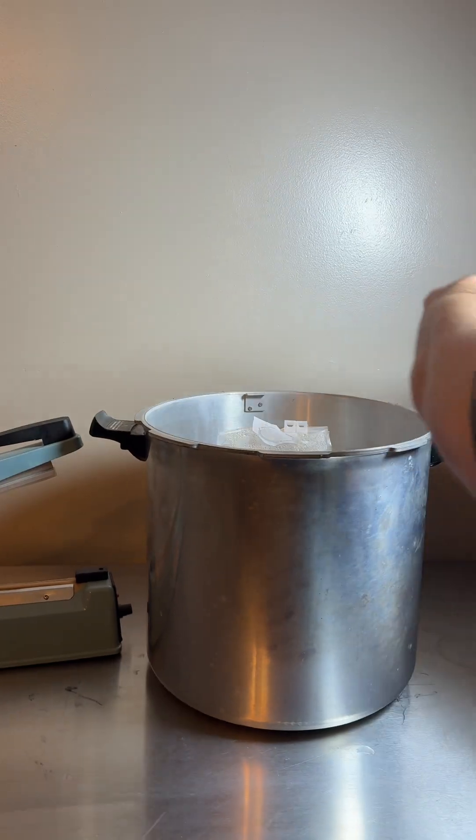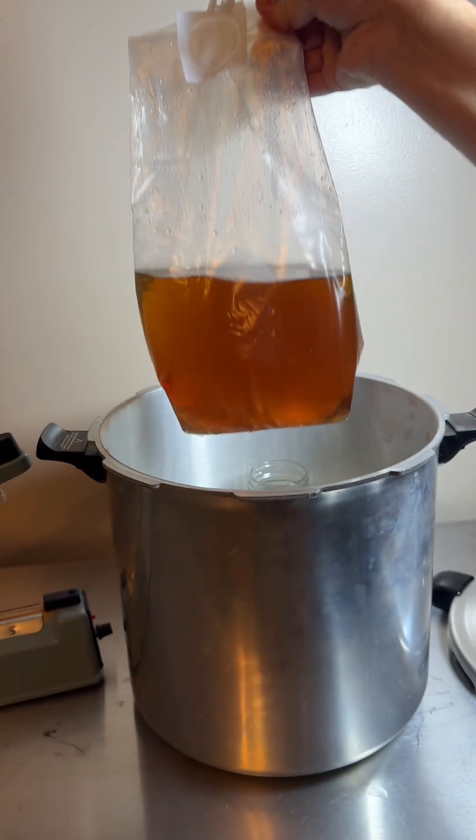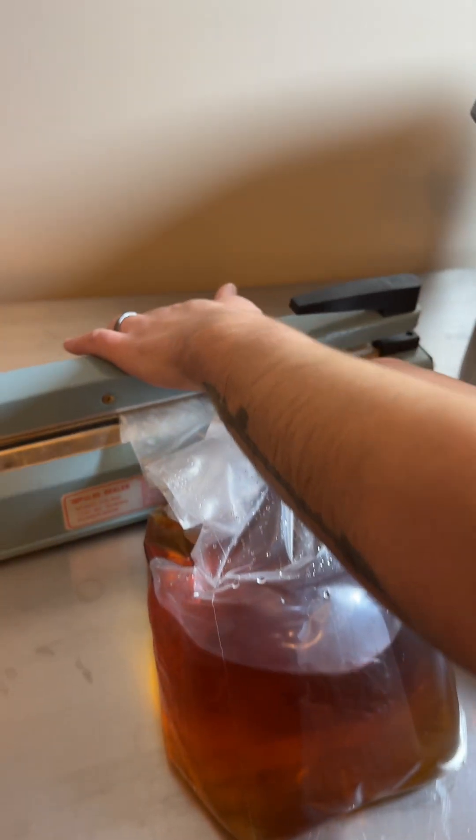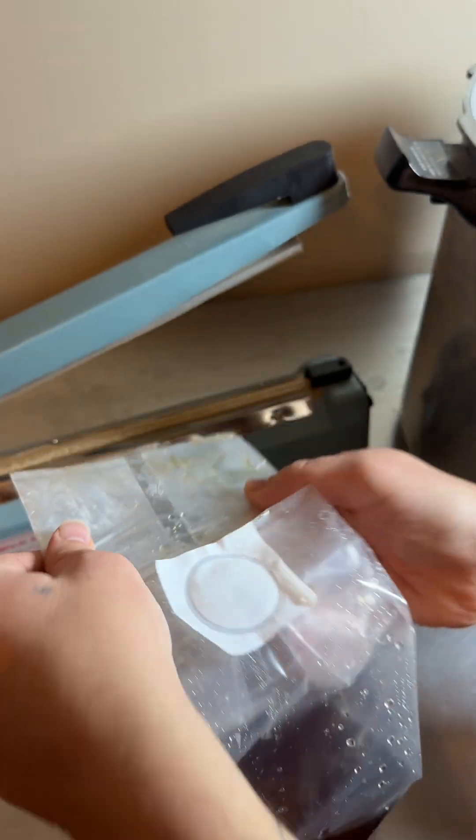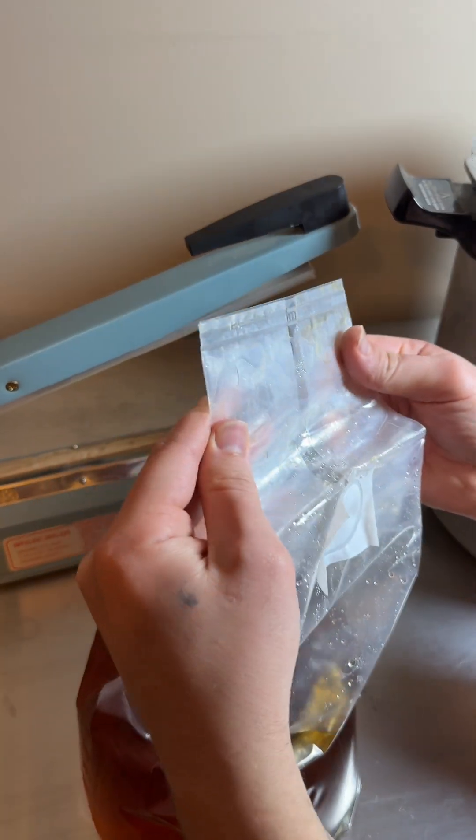And then I pressure sterilize the bag at 15 PSI for 25 minutes, and then I bring it out when it's cooled down and use an impulse sealer to seal the top of the bag.